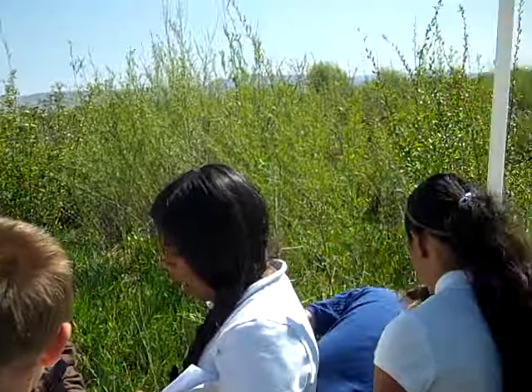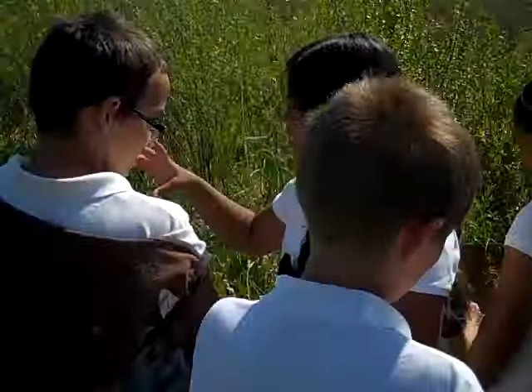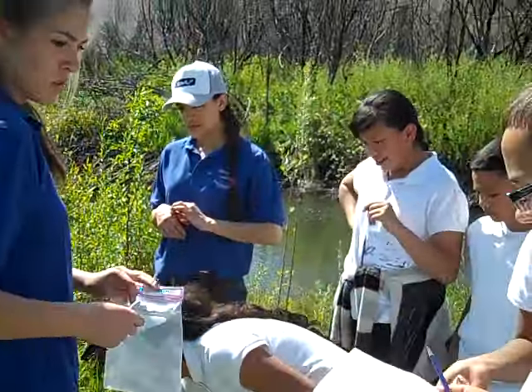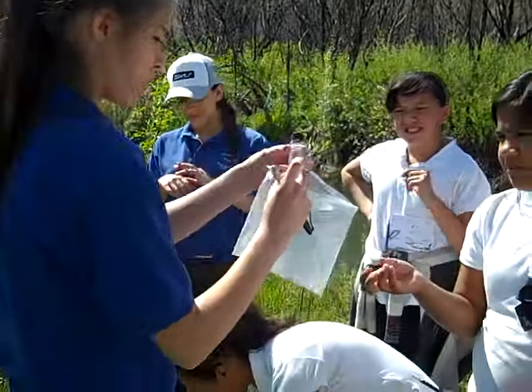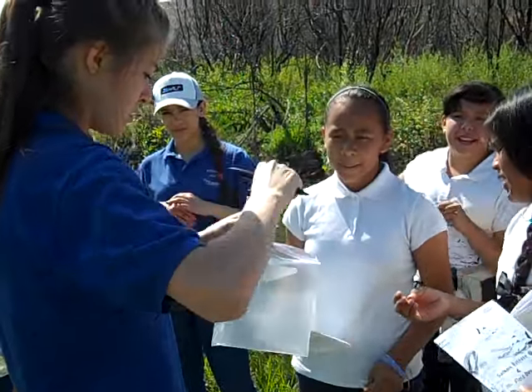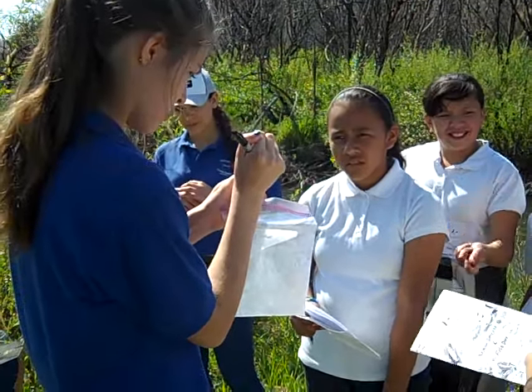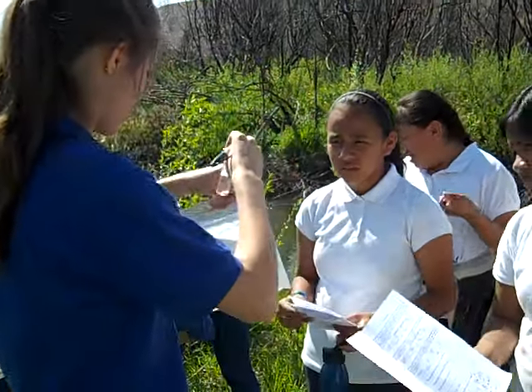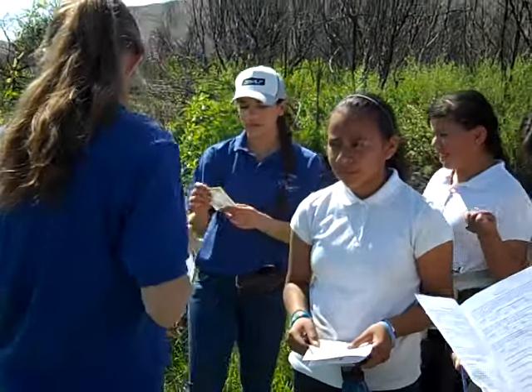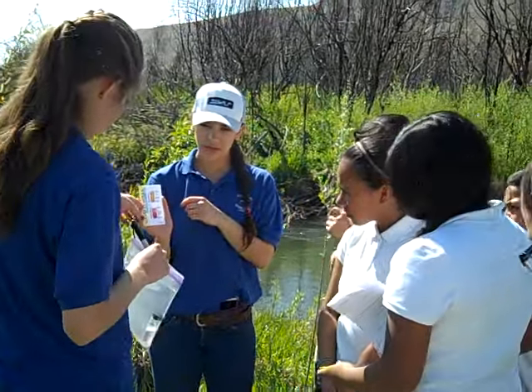I want to look at it. Yeah, you can take it. Alright, here, let me see that. Still sticking to the bottom. Yeah, it should stick to the bottom. Alright, what group are you guys again? Pink salmon. Okay. Alright, so I'm going to put this in here, and then your teacher's going to take that, and you can see the results on Monday, I believe. So we'll take this, you guys can take that.